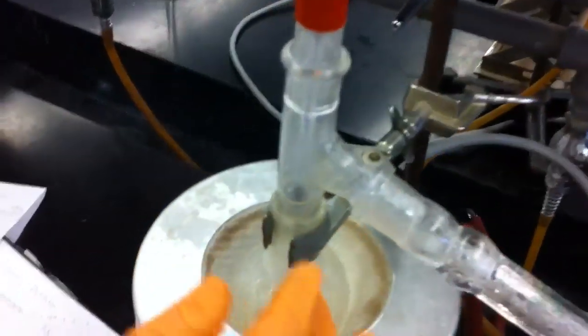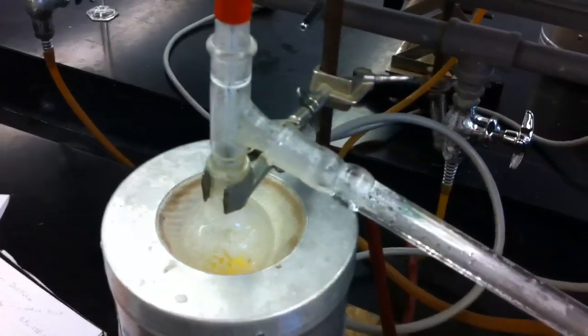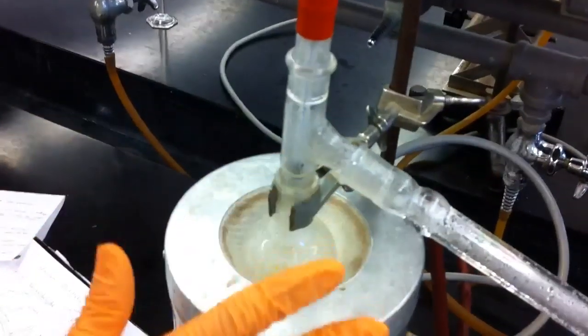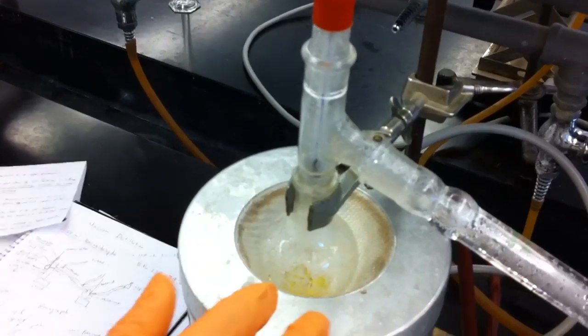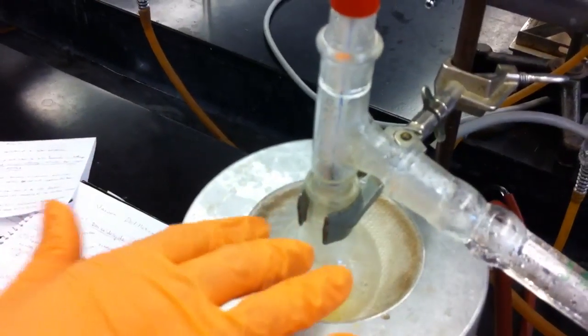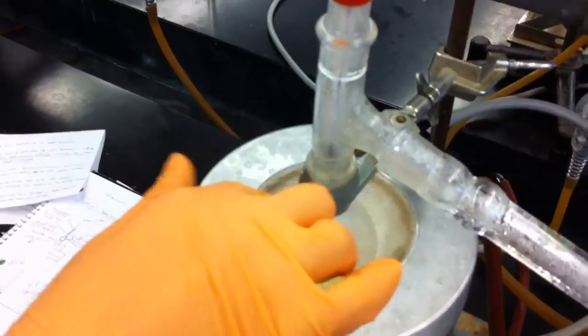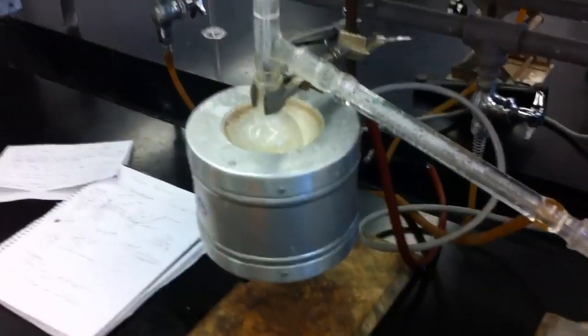In here, you also have the holdup, which is material that doesn't have enough pressure to move to this side, so that will be lost in the reaction. But also, you have the reflux, as you can see some of the compound is condensing from vapor back into the solution. We'll talk about this product as well and that is our setup.